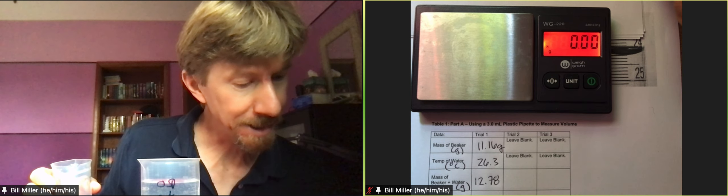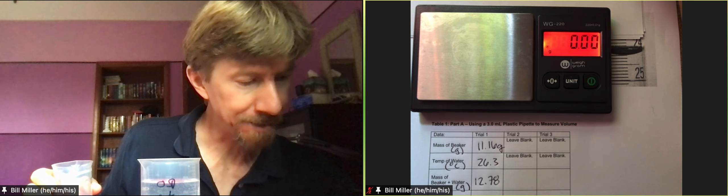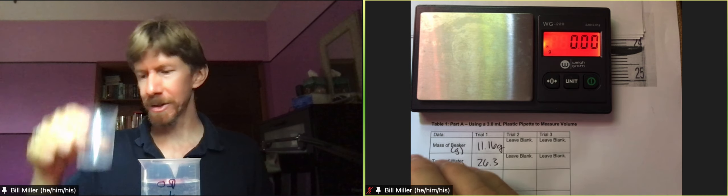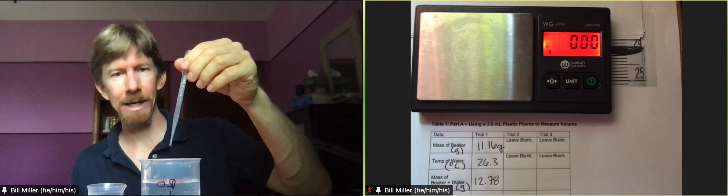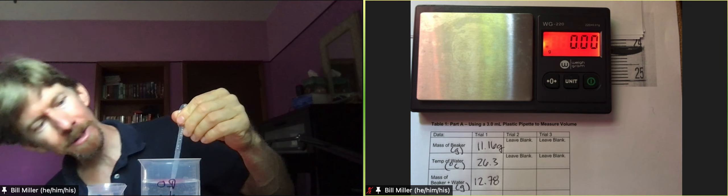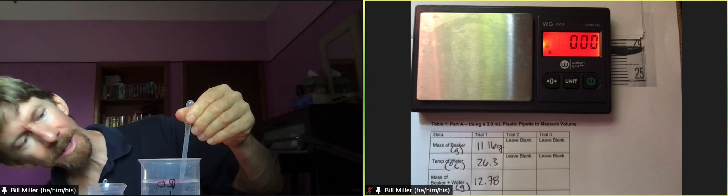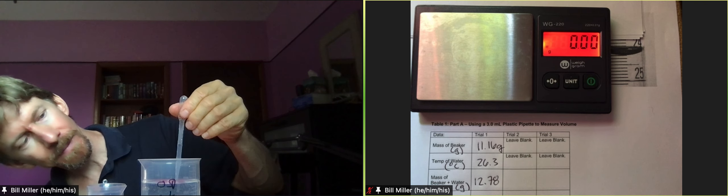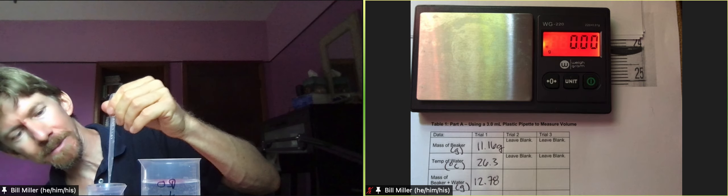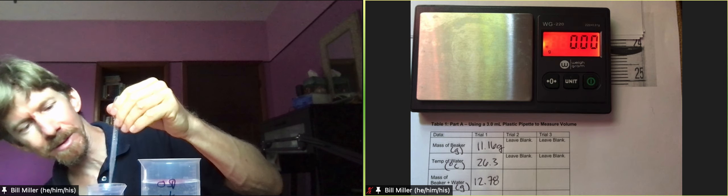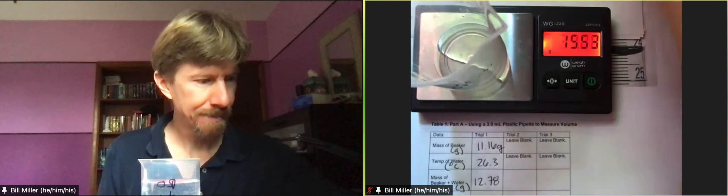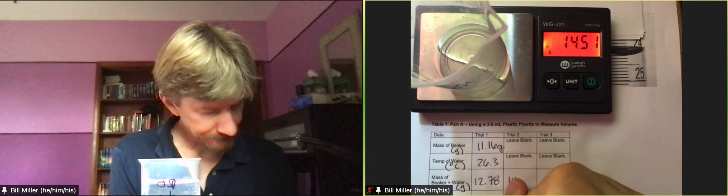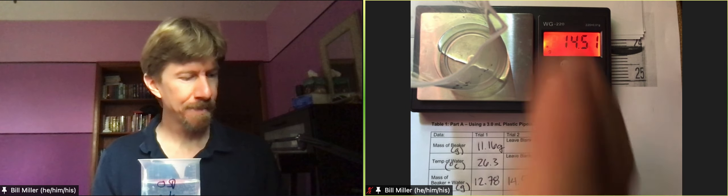I'm not going to empty this and that's what the instructions say. It says record the mass, then repeat the measurement multiple times without emptying our beaker between trials. So I have my first two milliliters, I'm going to do my second two milliliters again. Squeeze, put it under, suck it up very carefully without getting any air bubbles, move it over and squeeze it out until it all comes out and then I will weigh it again.